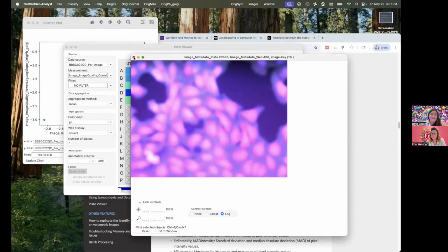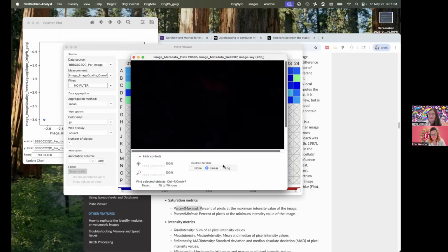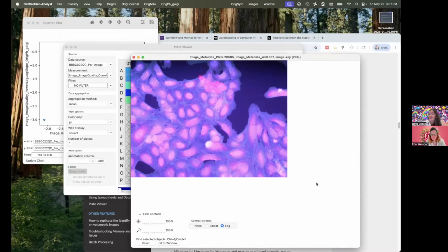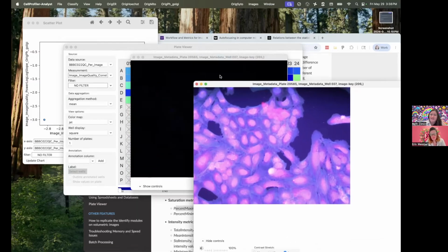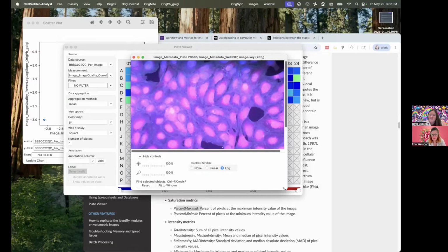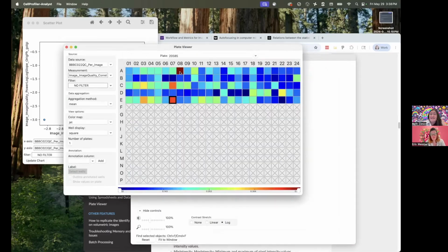One cannot deny that that image could be better. But here's the next highest one, and this doesn't strike me as terribly blurry. There's an out of focus guy or piece of debris there. Let's check the other one. So this is where I say it can be really difficult to define exactly what the cutoff is, because this is the second highest, and this is fine, but this one is clearly not.